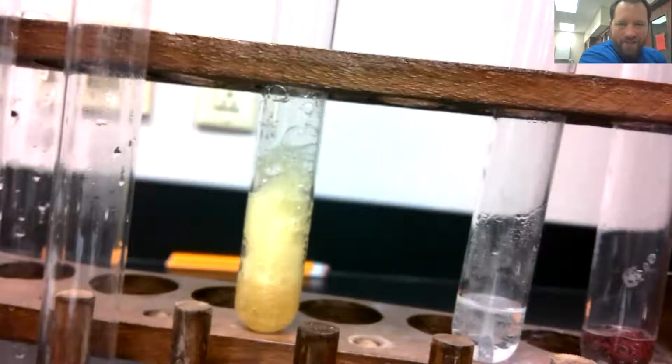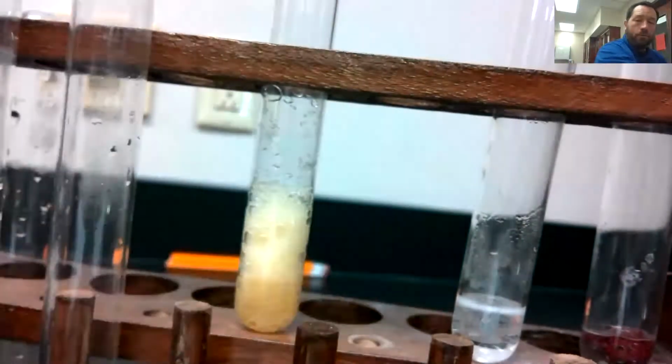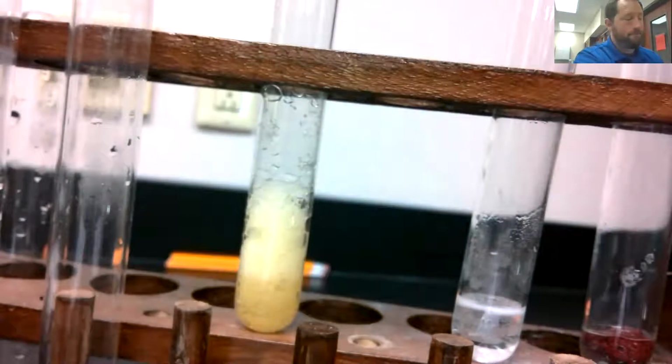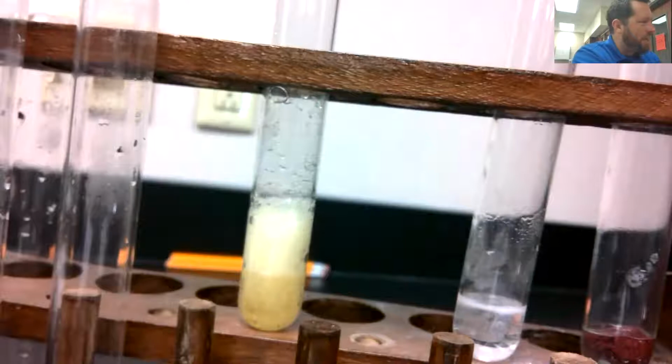That's interesting, huh? Again, don't write color change. That catalyst had that yellowish, orangish color there. But what did we have produced? So feel it here. A little bit of warmth. Yeah, a little bit of warmth. A little bit of warmth, but big time. What are you guys seeing there? What is the main indication there that we are witnessing a chemical reaction? Look at that thing go.